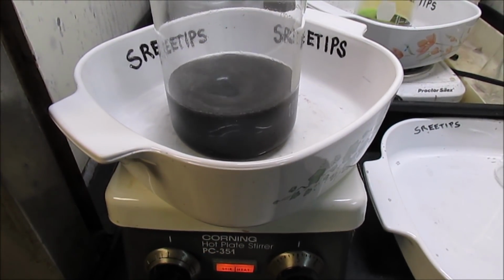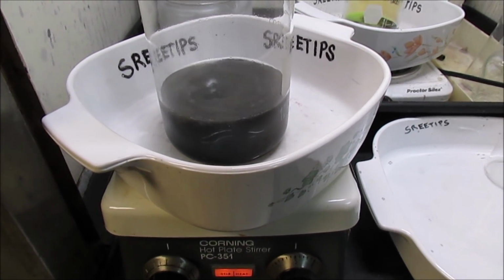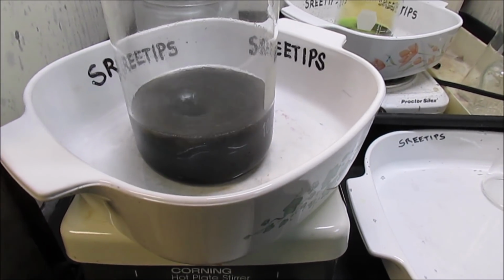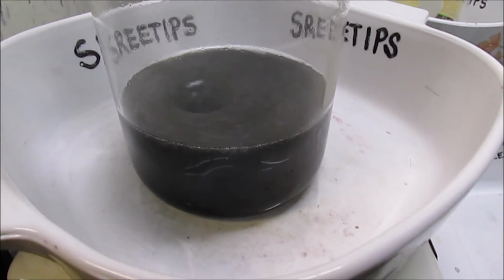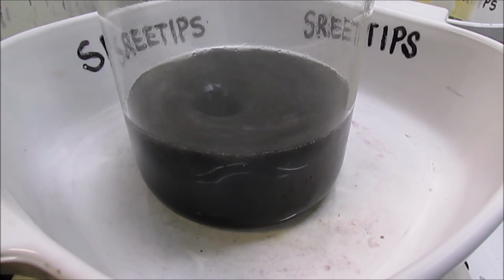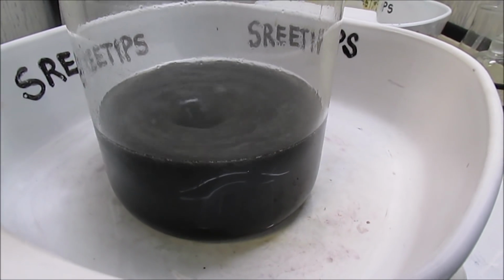Alright, the mixed black PGM powders have been boiling now for a few minutes. They've been on there for about a half hour now. And we're going to let this go for about an hour. And we'll turn the stirring off, let it settle. We'll test some of the solution, see if it's got copper in it.